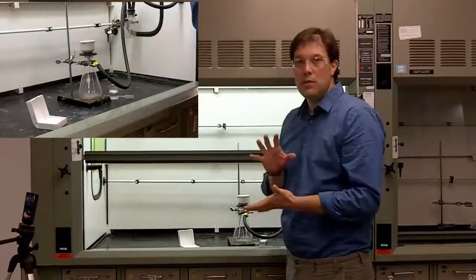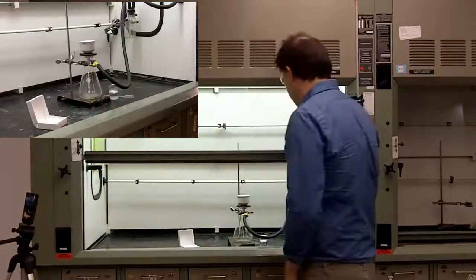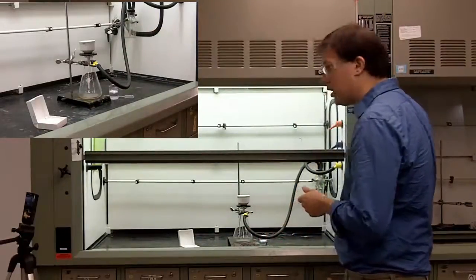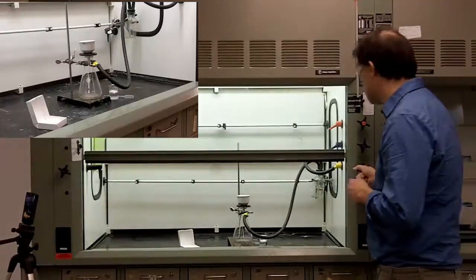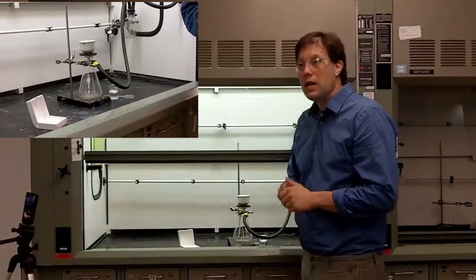Now for the paper you need to make sure that all of the little holes in the funnel are covered. So we have our basic setup now, and all we need to do is turn on the vacuum, so we reach over and turn on the spout.